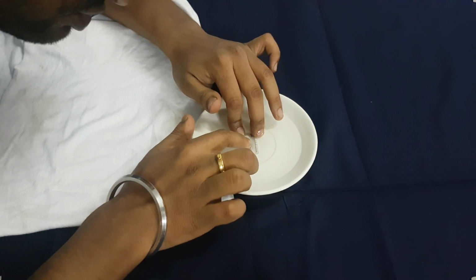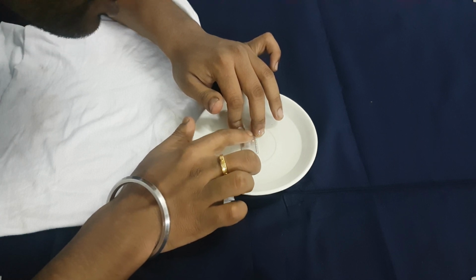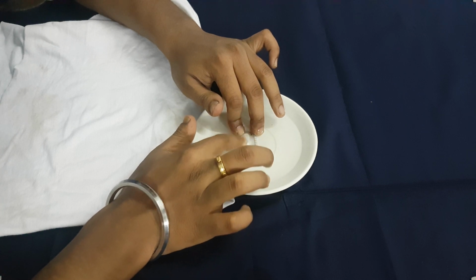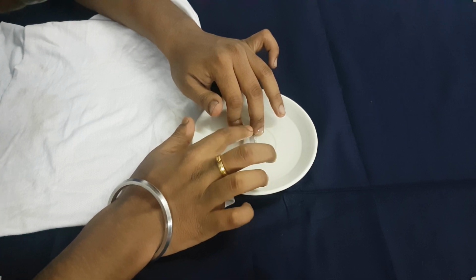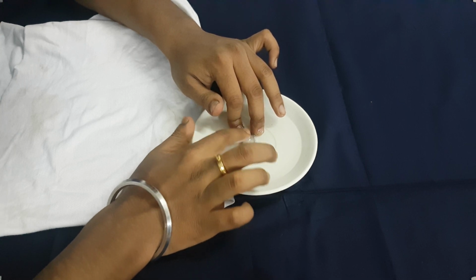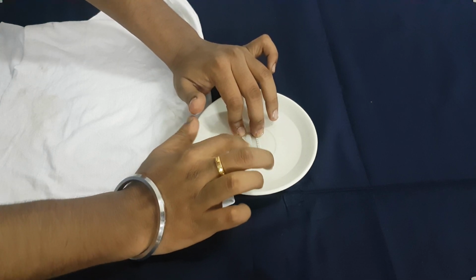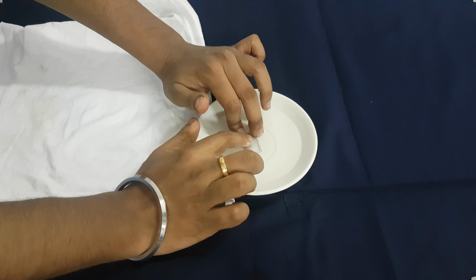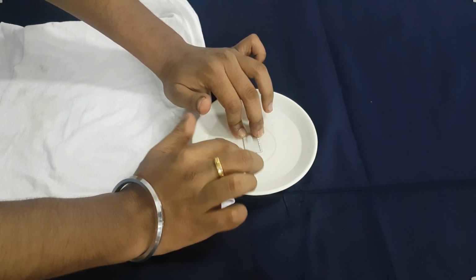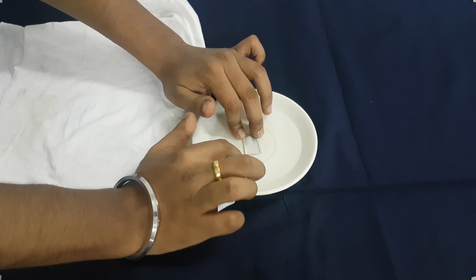the silicone sealant that we are using over here, I cannot tell the brand, I'll tell you the name afterwards, I forgot about this. The silicone sealant is insoluble in silicone oil. 50 cSt, I cannot tell you the brand again, I'm sorry. 50 centistokes silicone oil, that's it. You can get any brand of this silicone sealant, I don't care, but the results will be the same. The silicone sealant is insoluble in silicone oil.